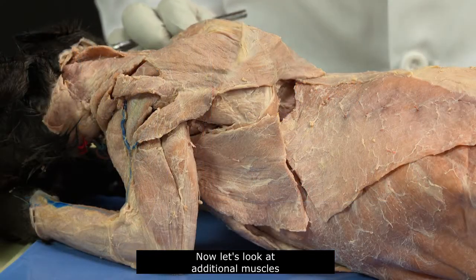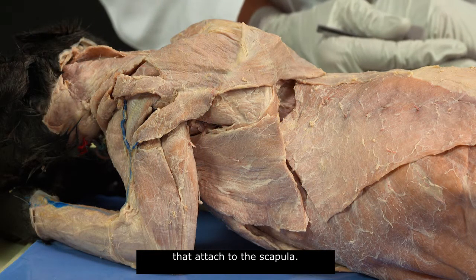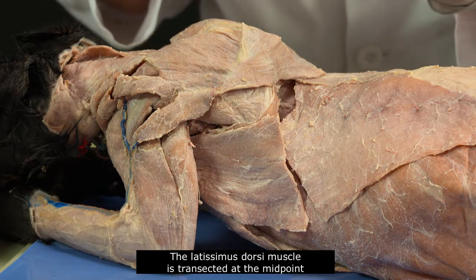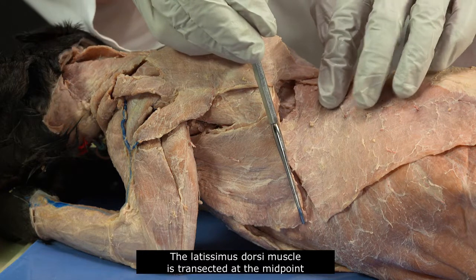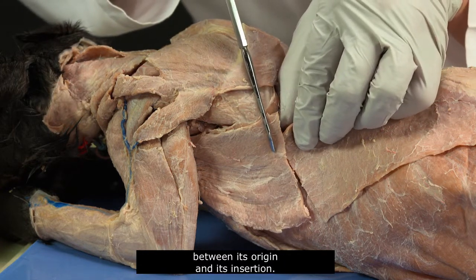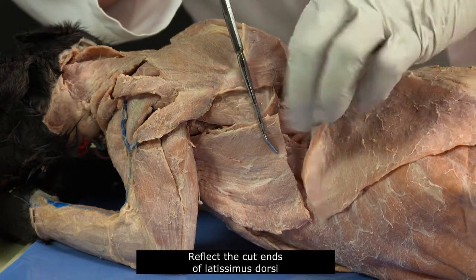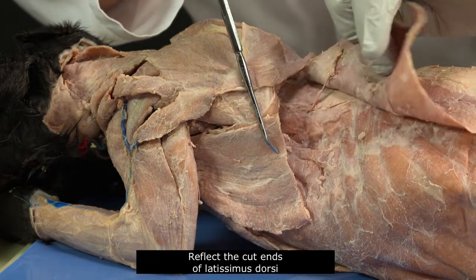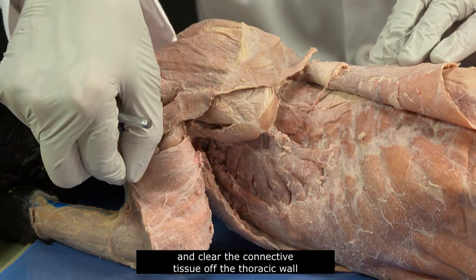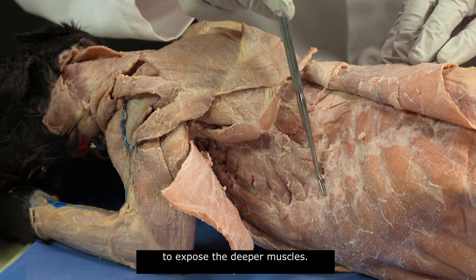Now let's look at additional muscles that attach to the scapula. We have reoriented to show a lateral view. The latissimus dorsi muscle is transected at the midpoint between its origin and its insertion. Reflect the cut ends of latissimus dorsi and clear the connective tissue off the thoracic wall to expose the deeper muscles.